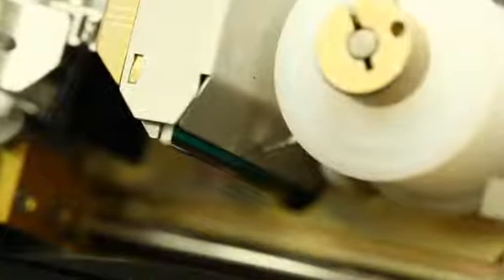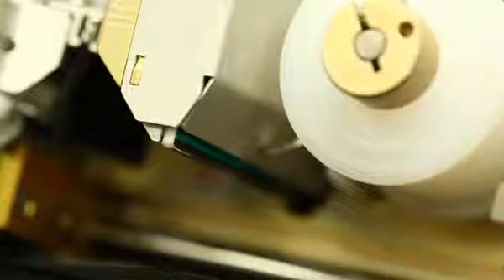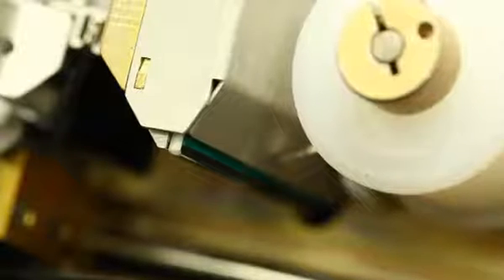Handling precautions. The heater line on the printhead is the lowest point on the printhead, the point that is directly on top of the slide when the printhead comes down. It is made from a ceramic glaze that can be cracked. Avoid striking or dragging the tip of the printhead with cracked slides or any objects.